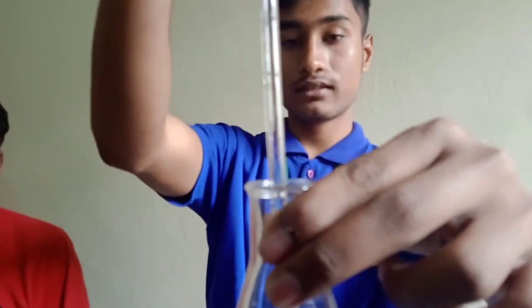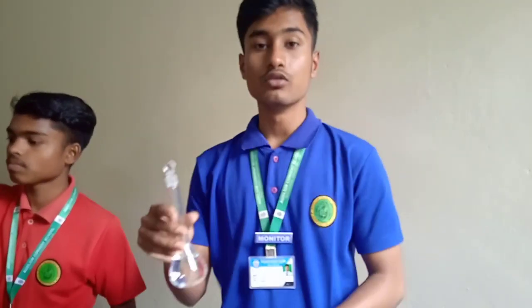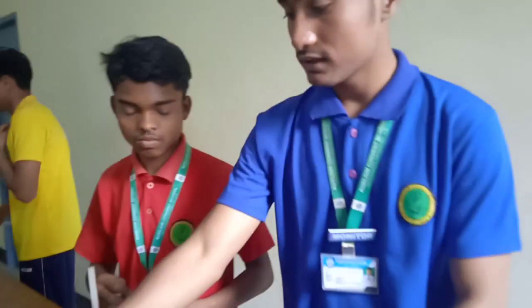We will release the finger and the solution will enter the flask. We have to do this twice. Make sure after doing this you don't stop, because we have to do this process thrice. When we do this experiment thrice we can take an average, which will be the answer. We will keep this inside.